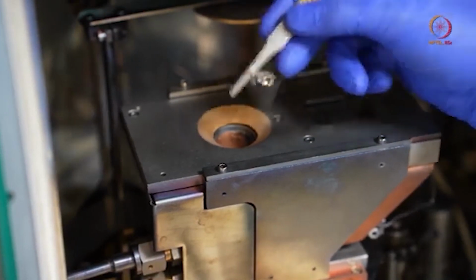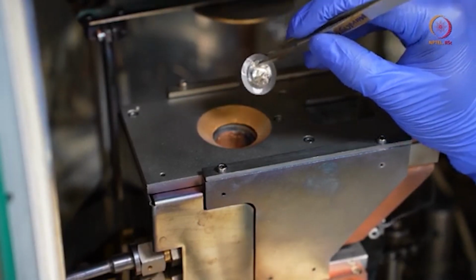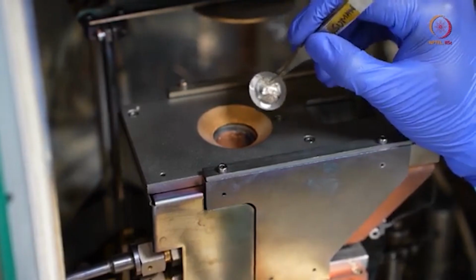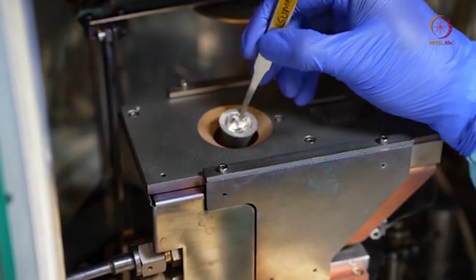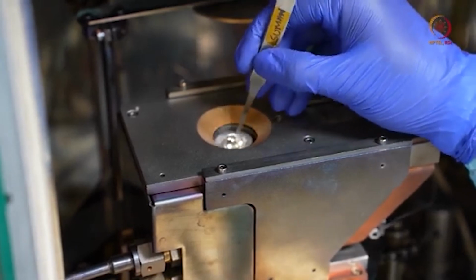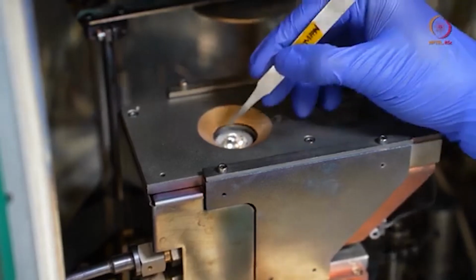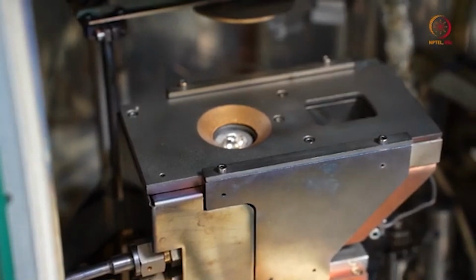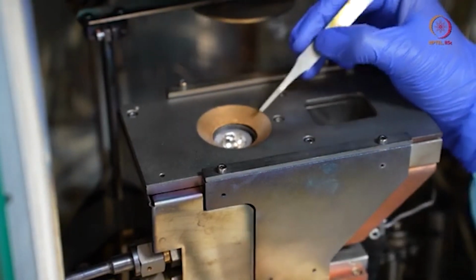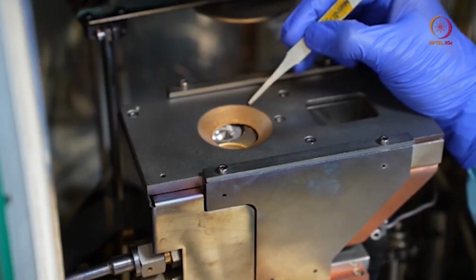Before any deposition you should check whether enough material is there for the next deposition. That is something you should follow. You should not end up depositing your crucible material on your sample. That is something you should check. So this is the first one, titanium is loaded here. Then we already changed the things, so you can check here. See, it is rotating, moving to the next crucible.